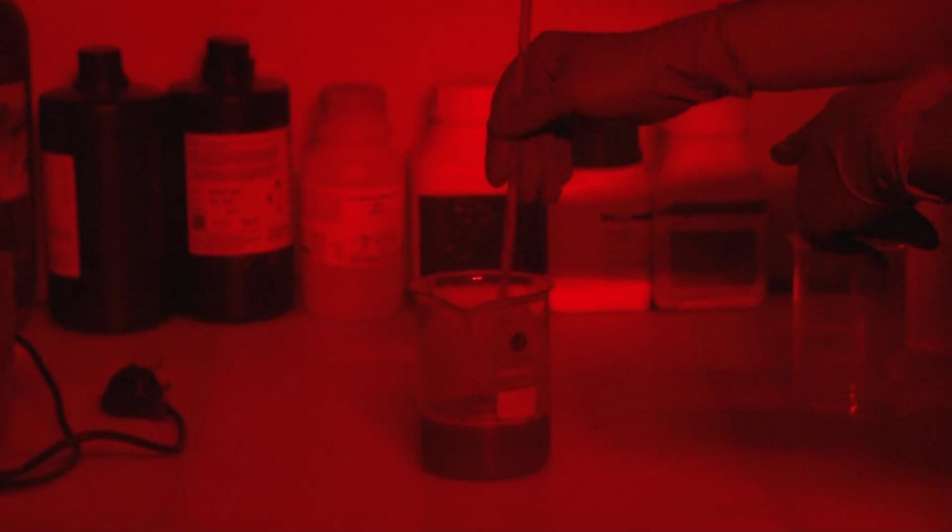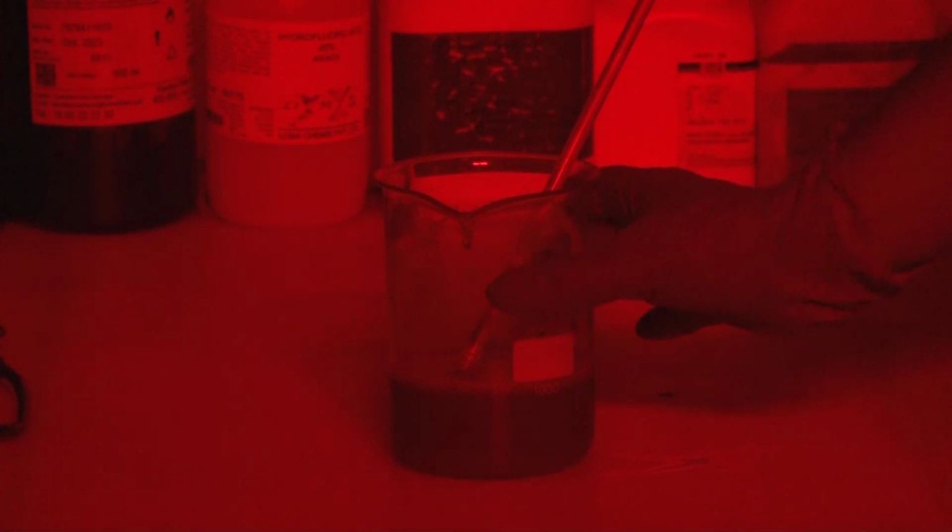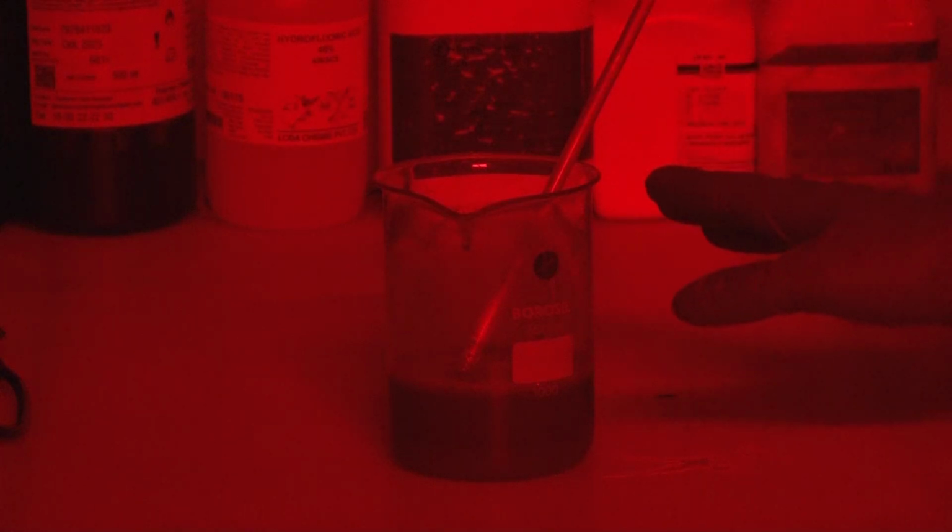I have poured the sample with the hydrogen peroxide, and once you pour it, you keep this sample for at least 12 hours. If there is any organic content in your sample, that organic content will dissolve. So you have to do this procedure for at least 12 hours. After you are done with the hydrogen peroxide part, you have to wash your sample, and when you have washed your sample 2-3 times, you will dry your sample.